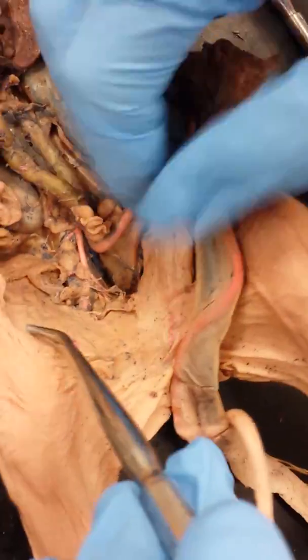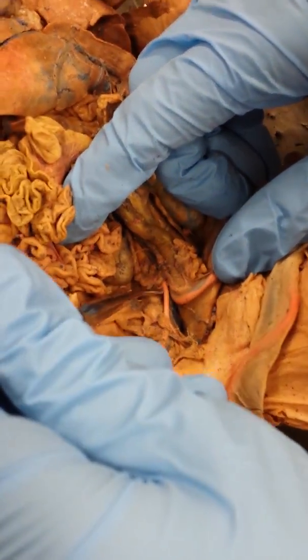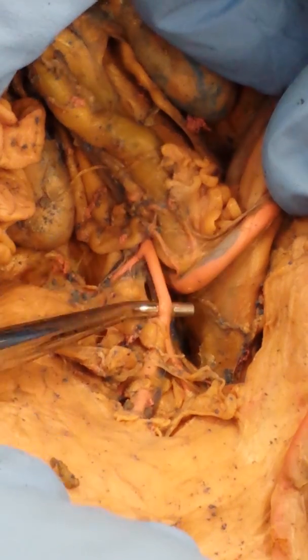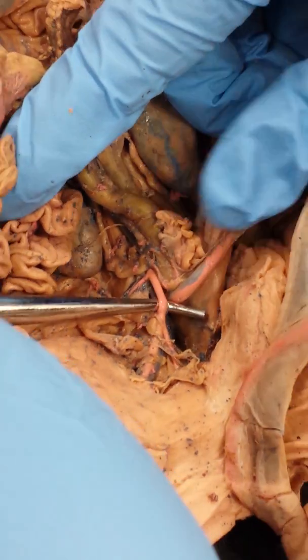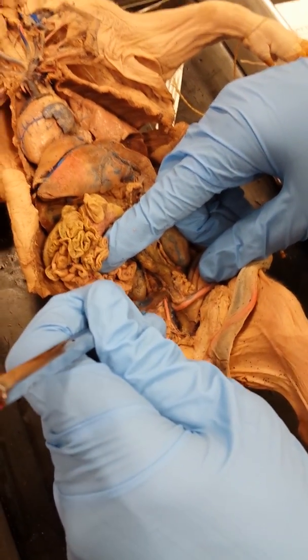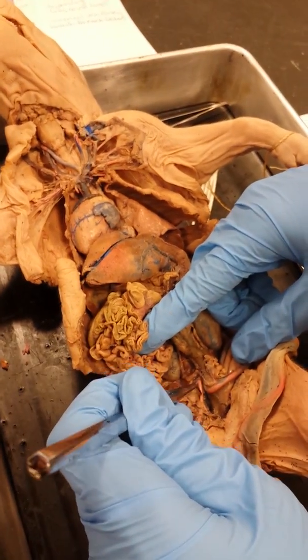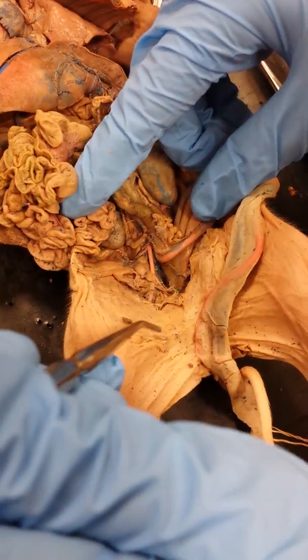Alright? Now, going back to the aorta, called the dorsal aorta, let's take a look into the pelvis. You're going to be looking for a nice, pretty pink artery. That's called the external iliac. Okay? Now, it's really important that you understand that there's no common iliac arteries. Alright, so we'll come and form the external iliac artery. Alright, the femoral we didn't really point out, so don't worry about that.